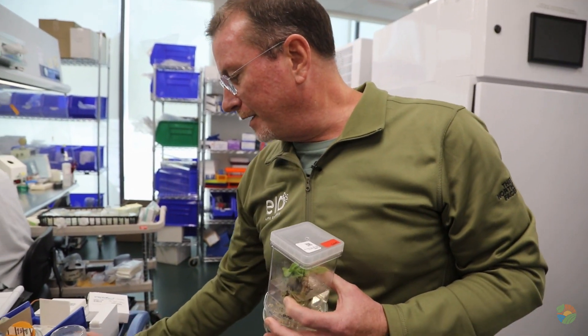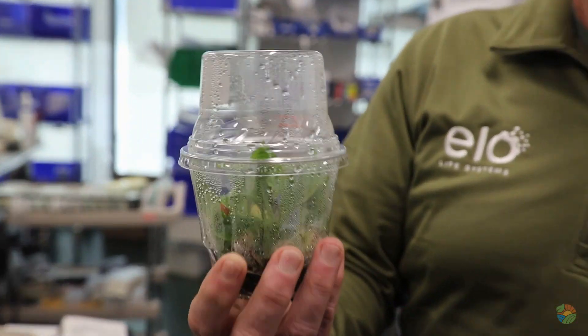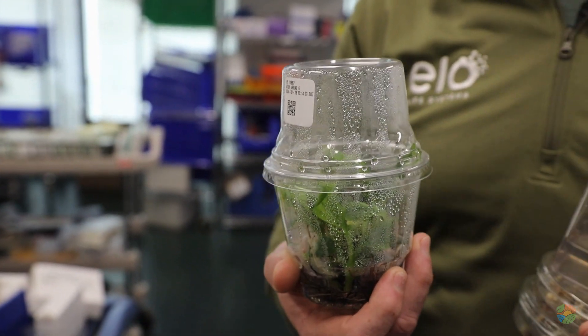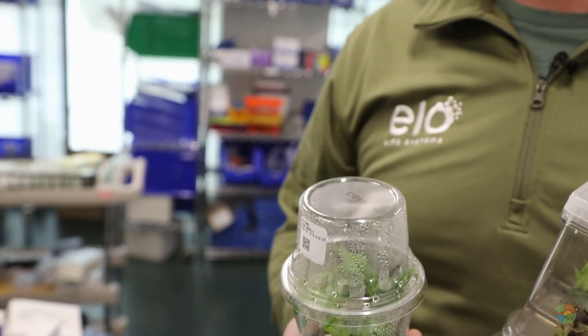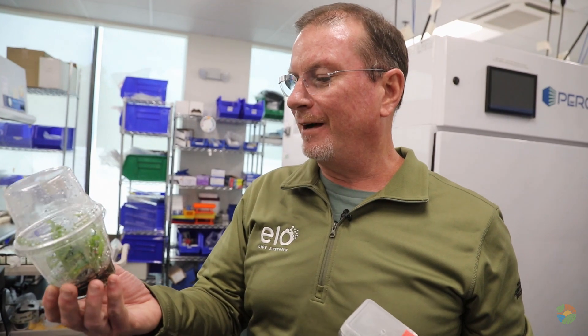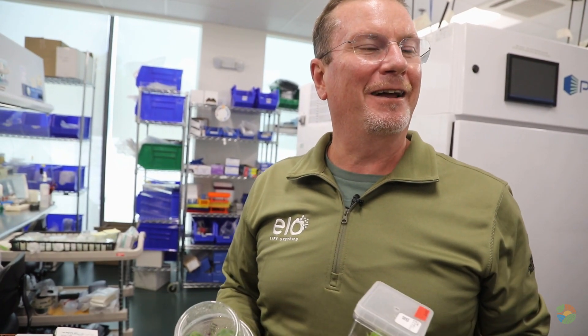This is sort of an adolescent that's coming along. And then ultimately in the last stage of tissue culture, they get to that bigger point where they're ready to go to soil. This guy's ready to be planted and fend for himself — that's a baby banana tree. We don't need to sing lullabies anymore; he's ready to start walking on his own, and that's when we move him to soil.